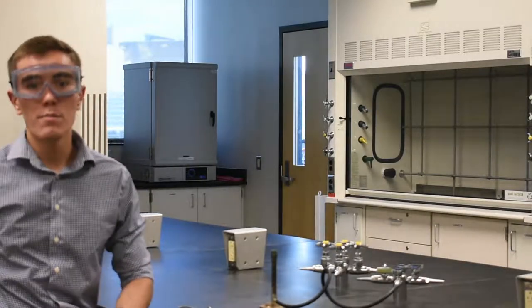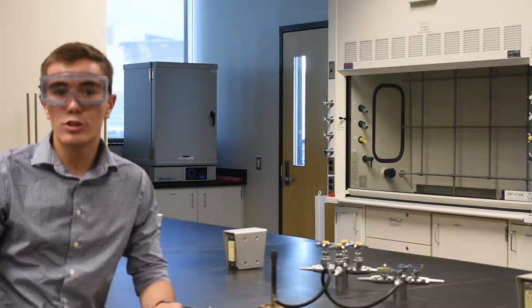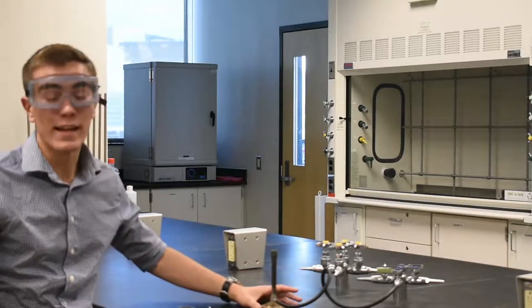Other things to keep in mind are to tie back long hair, make sure you don't have any loose clothing, and don't leave the Bunsen burner unattended ever.